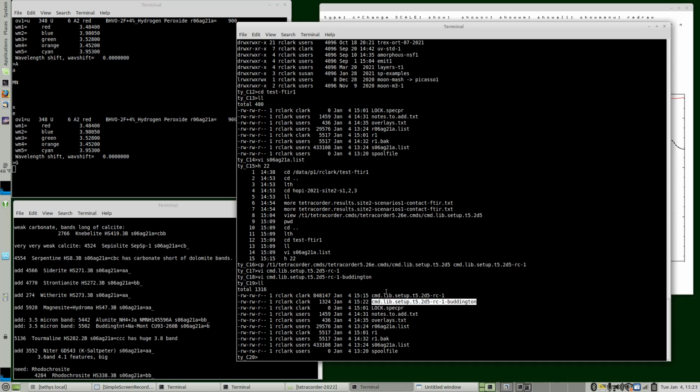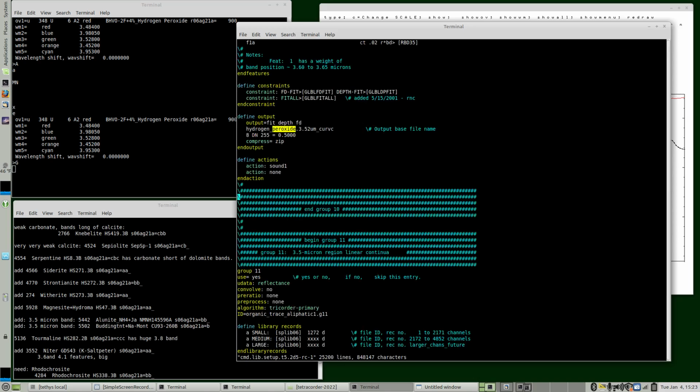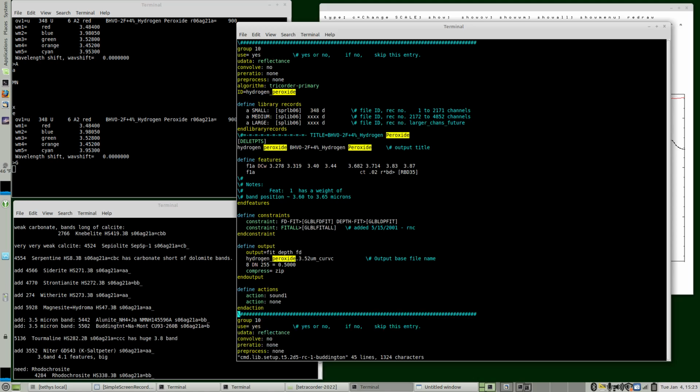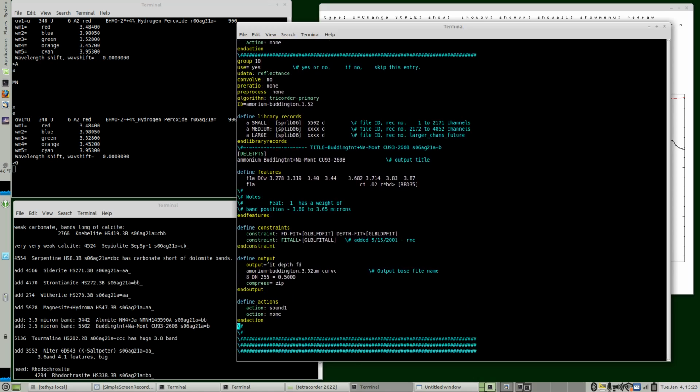We have this Buddingtonite entry, and we have this entry here. So let's edit this, and I'm going to put a copy of this file name into the copy buffer. So we're right here with the hydrogen peroxides. We can now add this in at the end. Actually, in vi, we do it a little differently. So there's the new entry, and we don't need a double comment there. One's fine. So we can double check. Ammonium Buddingtonite, ammonium, looks good, looks good. Output. So we're good there. This looks good enough now.